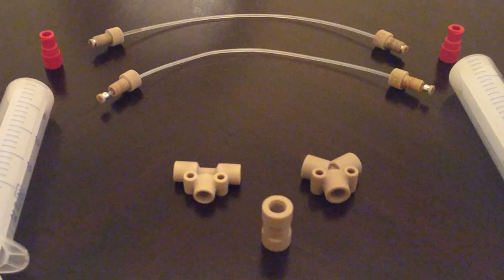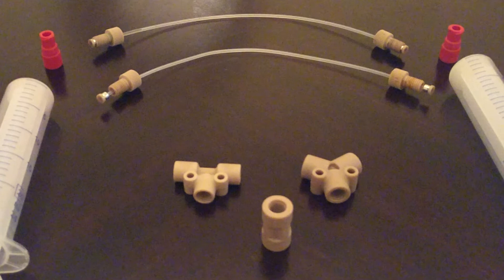To connect the tubing to other parts of the system, you will need to attach a screw onto the end. Now you can screw the tubing into any type of compatible joint.